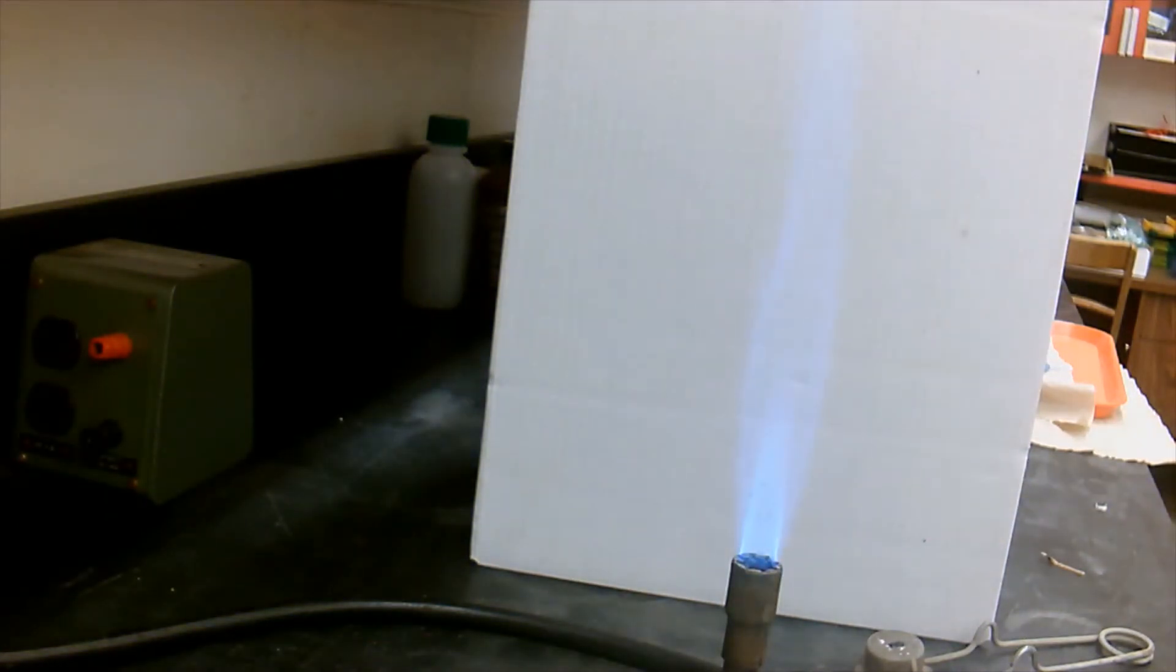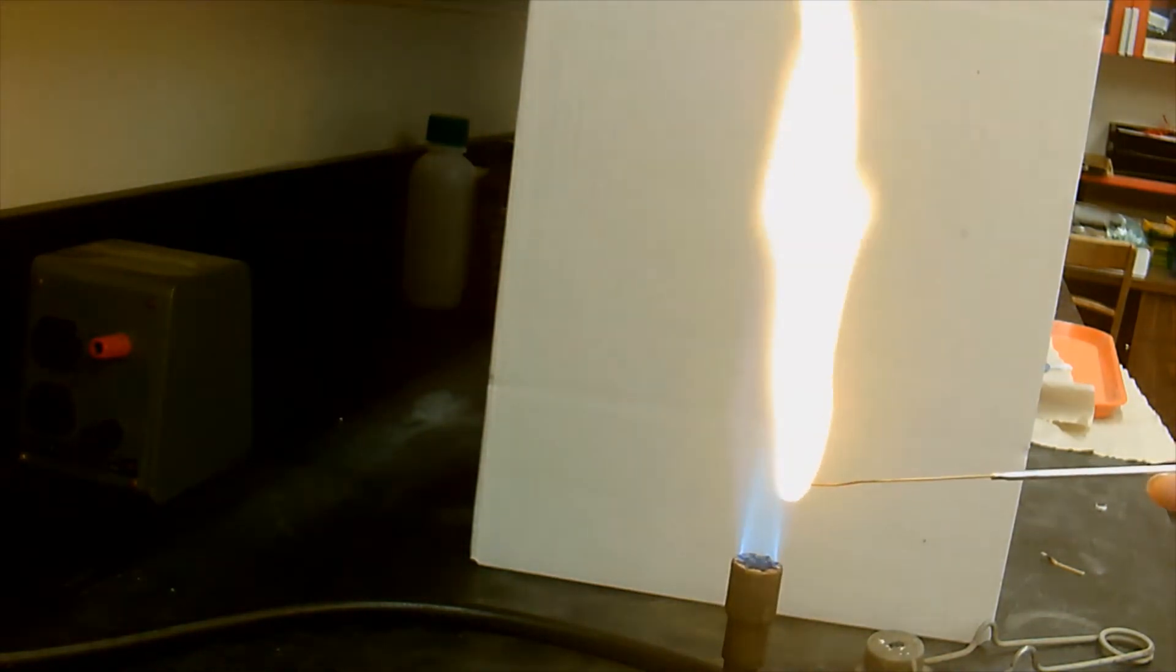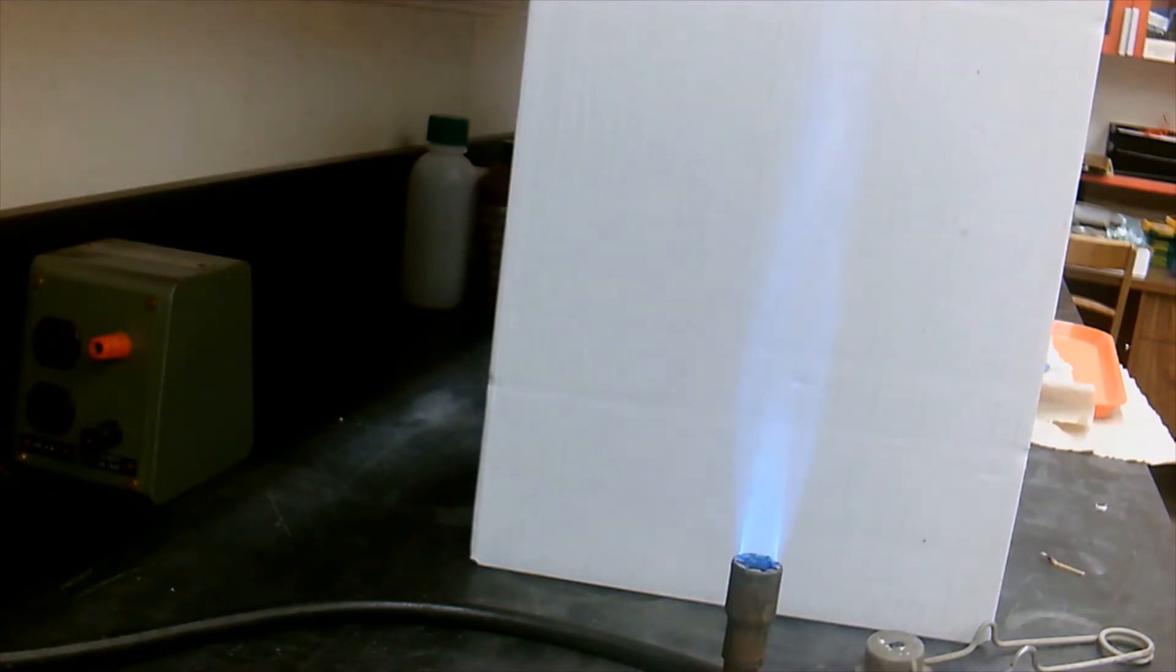That was our salt K. Let's see it again, just a little bit more. Let's do our last one, our salt L. All right, it's like light pink color. Light pink. It's our salt L.